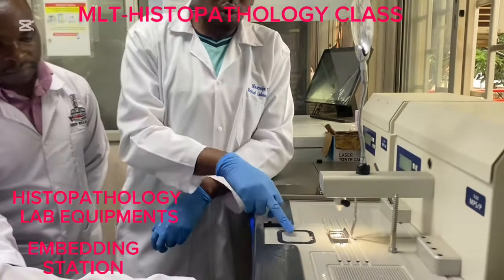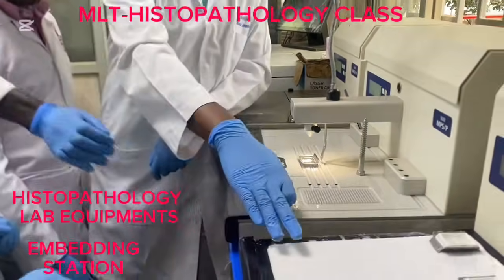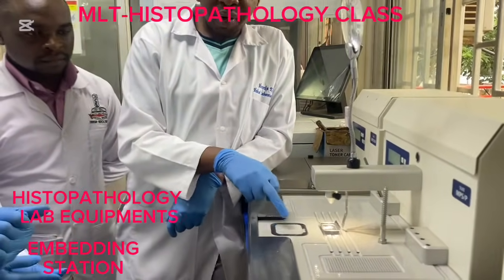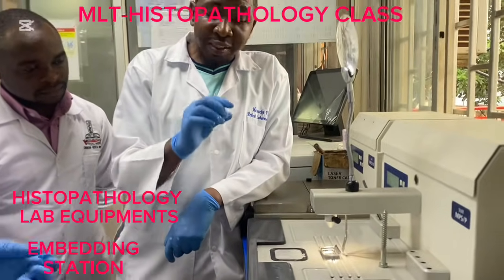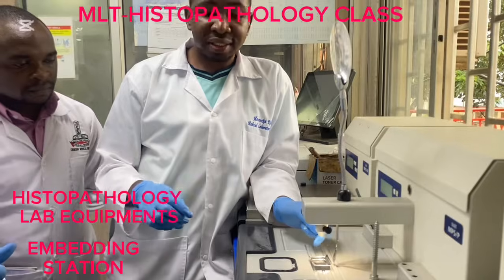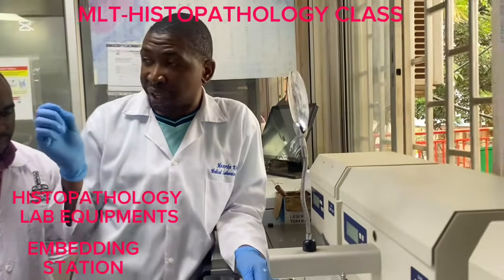And lastly, two cold spots. Number one, small cold spot, and number two, we have the large cold spot. Okay, so this small cold spot is where we carry out orientation majorly. Orientation is proper placing of tissue into the mold. So once you put paraffin wax, you've added your tissue, you carry the whole pack onto this small cold plate to carry out orientation.